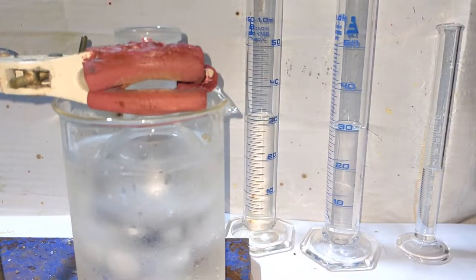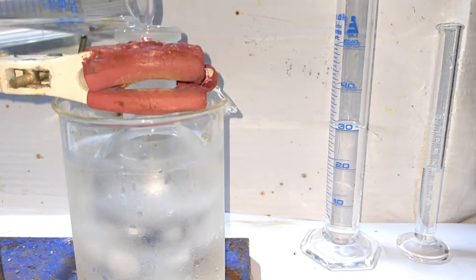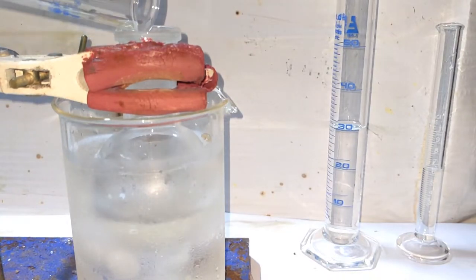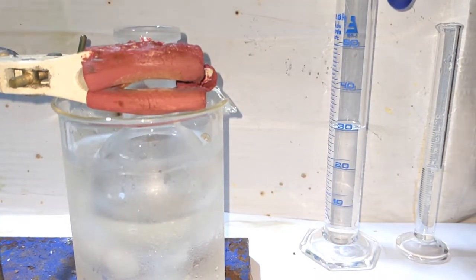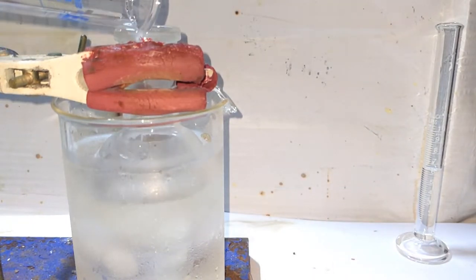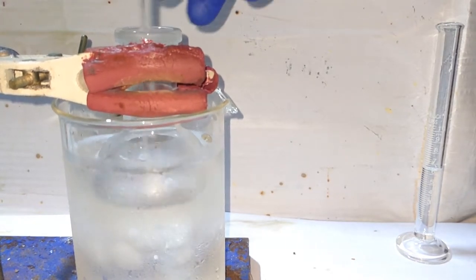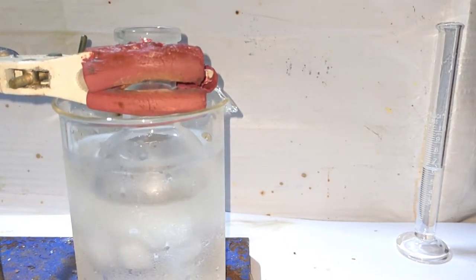First, add 30 milliliters of ethyl alcohol to the round bottom flask. Then add the glacial acetic acid, that is 30 milliliters of glacial acetic acid, into the reaction vessel. Now using a glass stirring rod, mix up the solution.